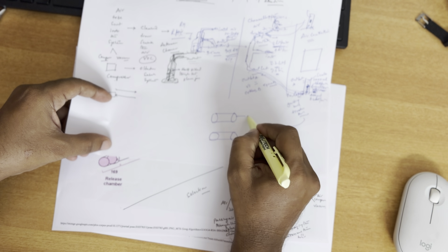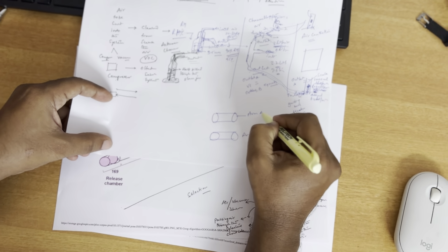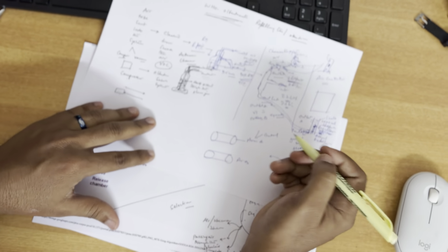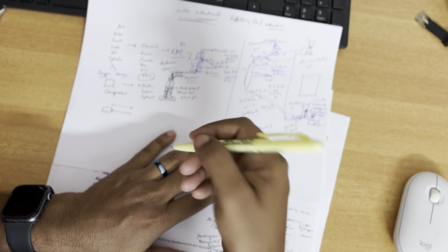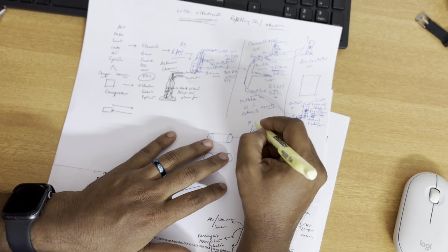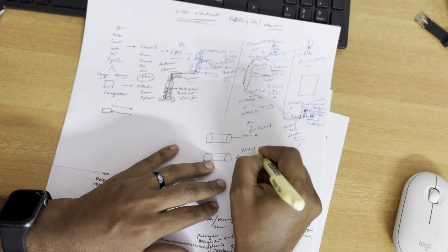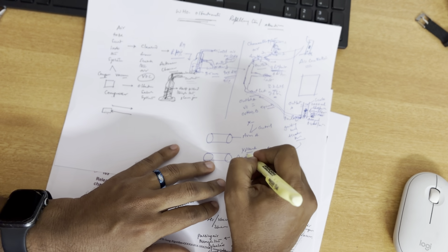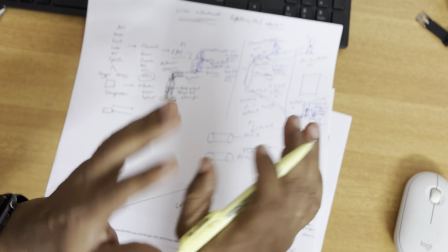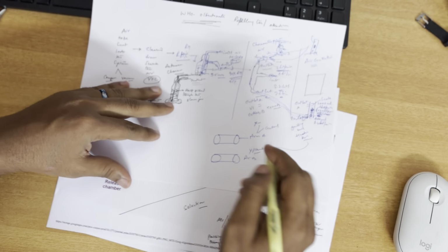So this is arm A, maybe arm B. Maybe arm A you are using as a control, or something neutral. You can also use two tests, like you already have a scent from X company, or maybe from X plant you wanted to test against Y plant, or maybe XY combination versus Y combination. You don't have to use a control. There is no control concept here. It is versus, like either this or this. So that's how you need to do the comparison.